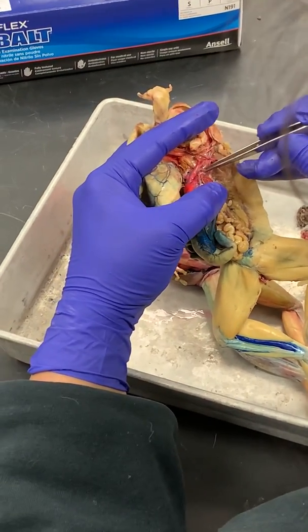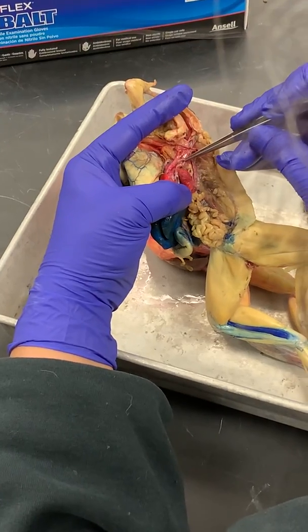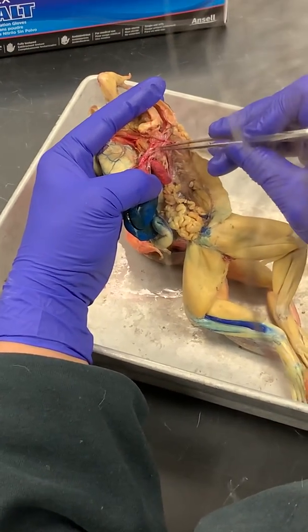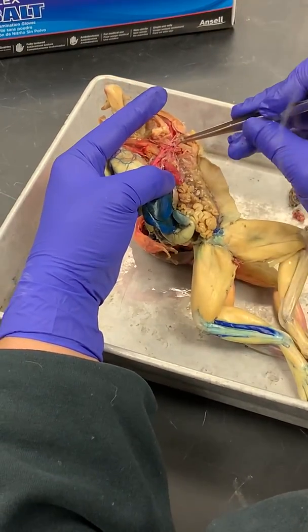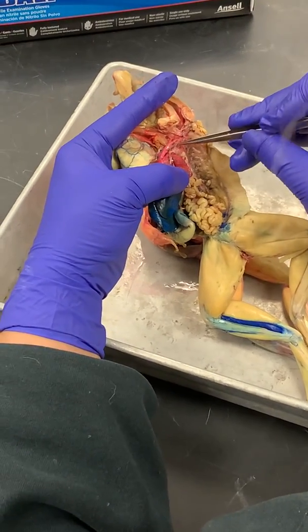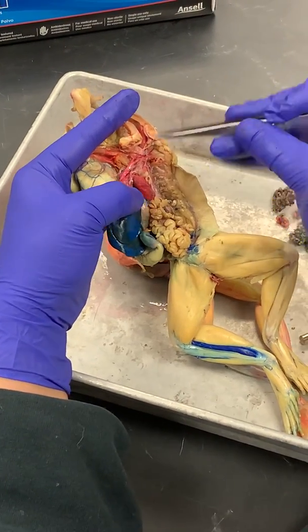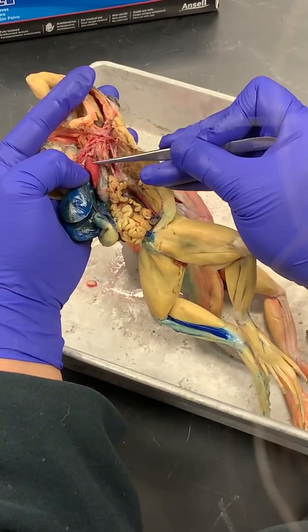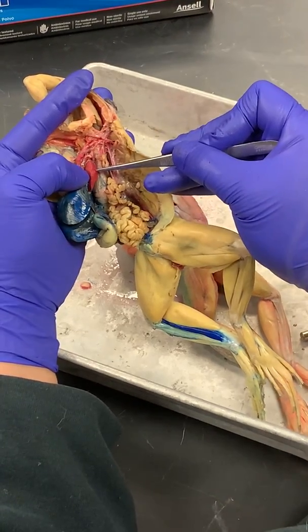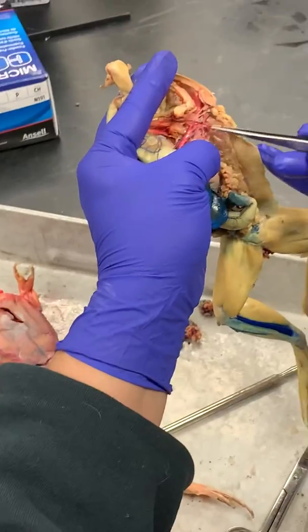And so finally, take a look here, this most posterior branch here, it splits into one vessel, see it's going toward the skin. So this is the pulmocutaneous arch. This vessel going toward the skin here is a cutaneous artery. And see this one going to the lung? That's the pulmonary artery. Okay, so pulmonary, cutaneous.